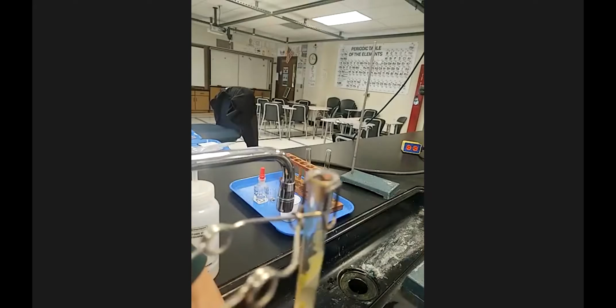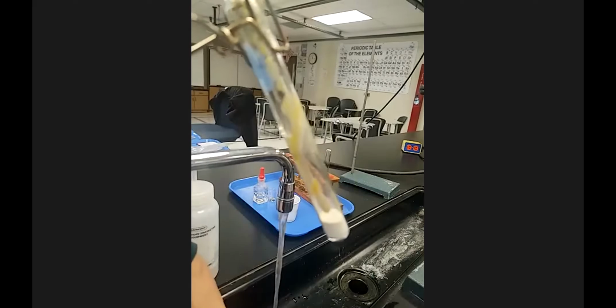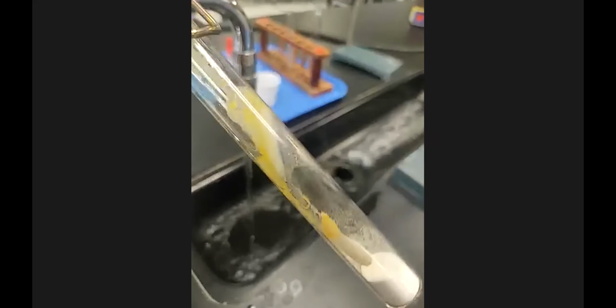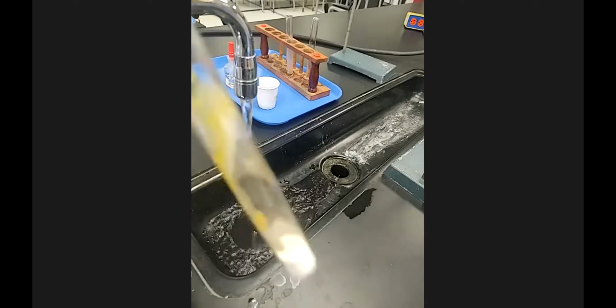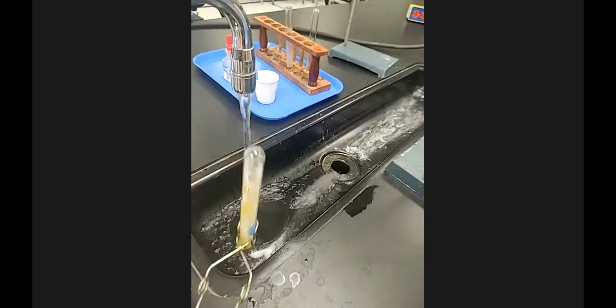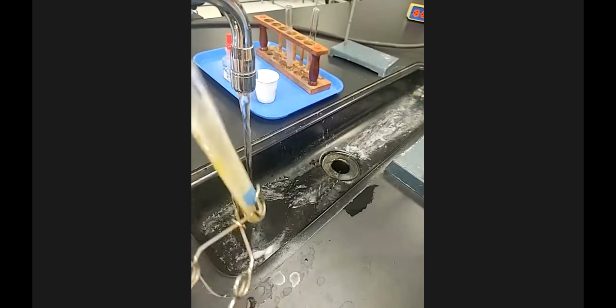What you don't want to do if you just have a solid in your test tube is add water to that, because you don't know the solubility of that solid and whether the water is going to help or hurt. So it's always a good technique, if you've got a solid and it says it's disposable, meaning it can go down the drain, to first just tilt your test tube and dump out, giving it a little tap, as much as possible before adding any water to the system.